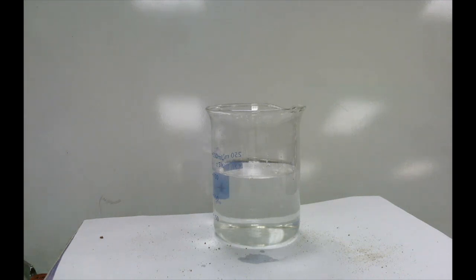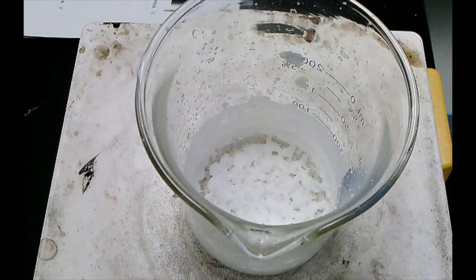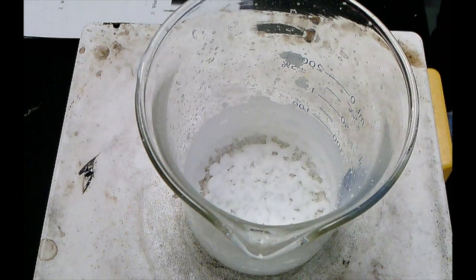The next thing we need to think about is how we might be able to separate a mixture of salt and water. It might not be obvious at first, but if we were to take this beaker of salt water and put it on a hot plate and boil it, we would be able to boil all of the water away and be left with just the salt. Here we can see an example of what it looks like once you've boiled all of the water away from the beaker of salt water. That white crust that you see at the bottom is the crystallized salt that's left after all the water has become steam.